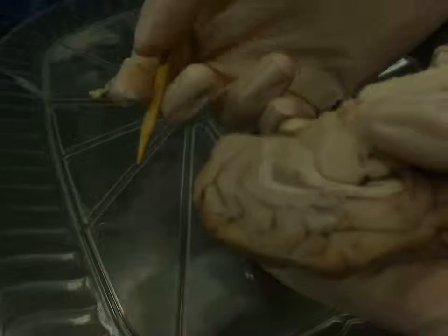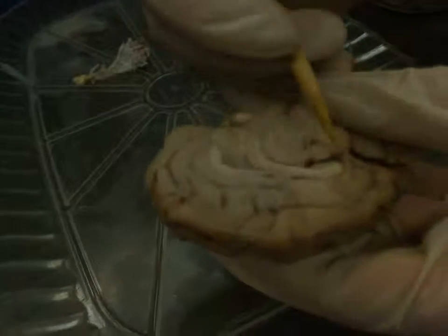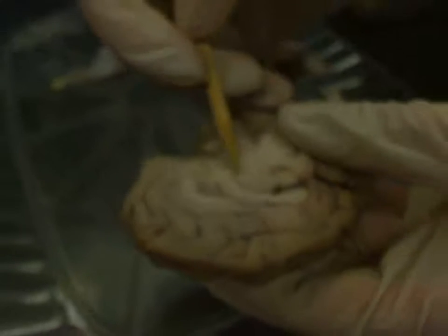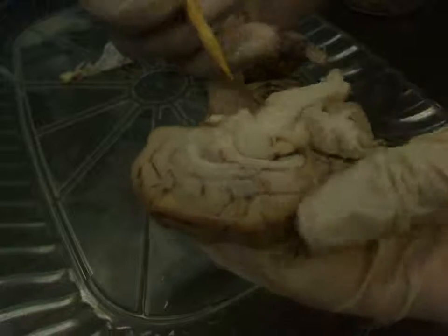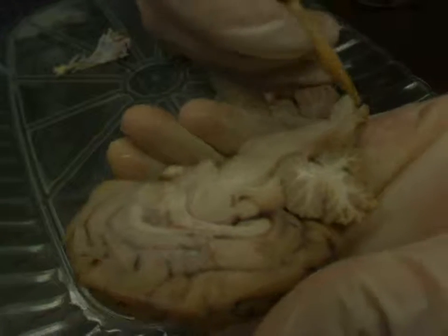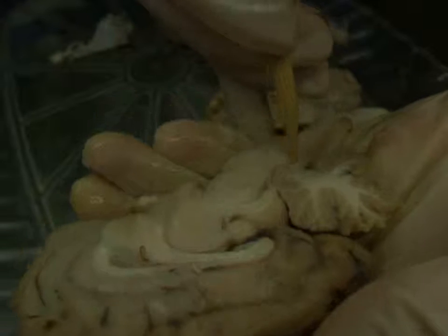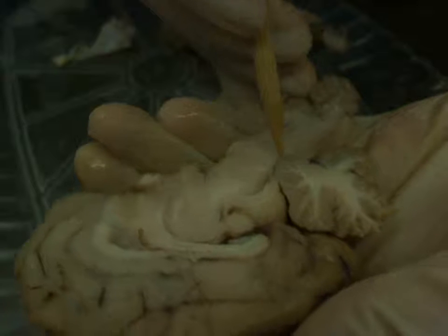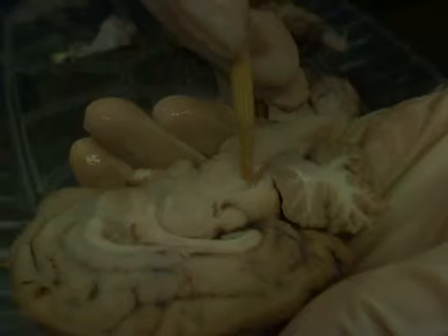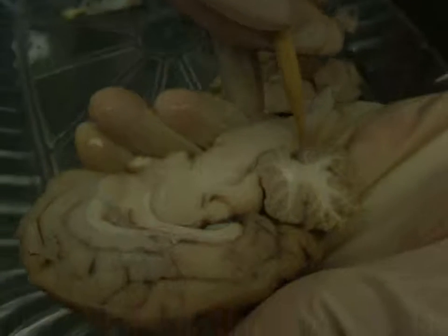Okay. So that's it for the four white matter tracts we saw: corpus callosum, fornix, anterior commissure, and mammillothalamic tract. Okay. Other structures we can see besides white matter include down the myelencephalon. We can see the space between the cerebellum and the medulla is the fourth ventricle. If we move up a little bit, we can see the cerebral aqueduct. It's also carrying CSF from the third ventricle down to the fourth ventricle.